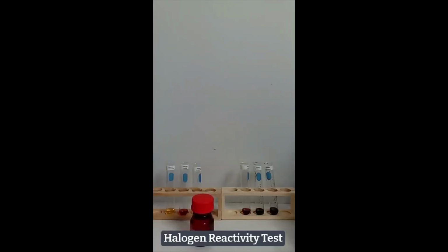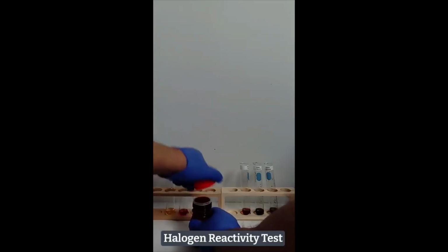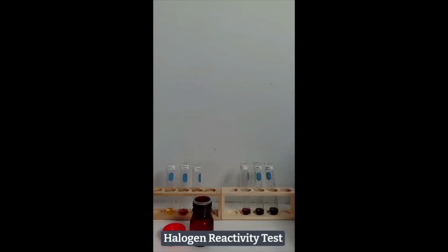Each test tube now gets 1 milliliter of methylene chloride added by the aid of a micro pipette.